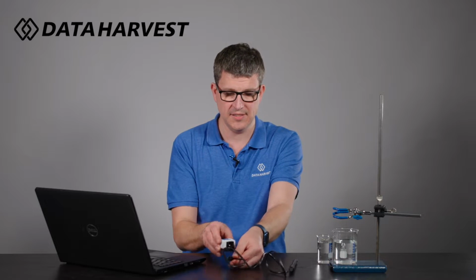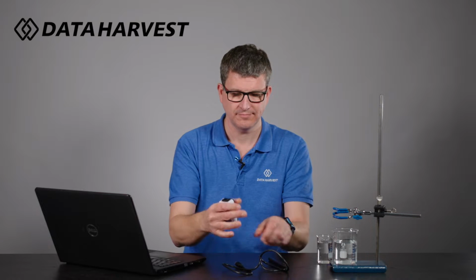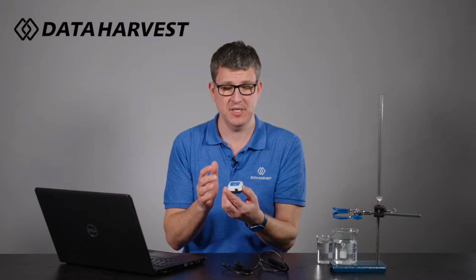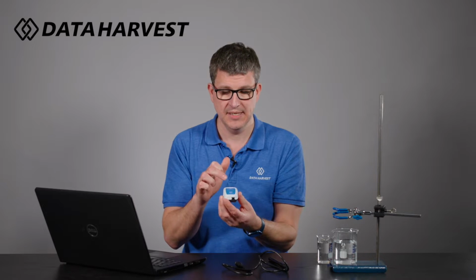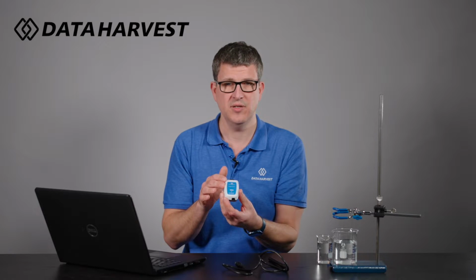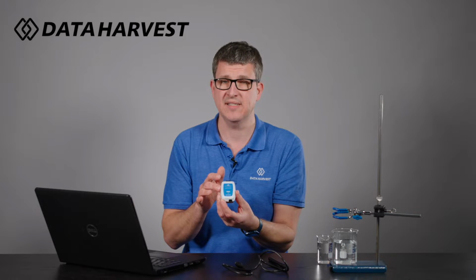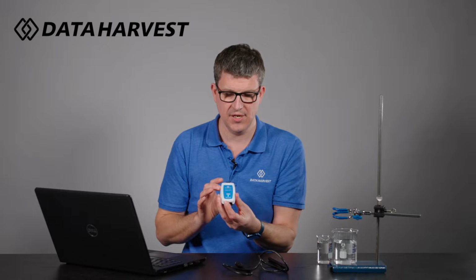So it comes in two parts. You've got the adapter and you've got the electrode here as well. All our wireless Bluetooth sensors are Bluetooth and USB, so you can see the USB connection there, and a button to turn it on and off on the bottom. They all have a unique 6-digit number, so you'll notice in a moment when I connect it to the EasySense 2 software that you can connect. And if you have multiple conductivities in one room, it doesn't matter because that 6-digit number is unique to this sensor.